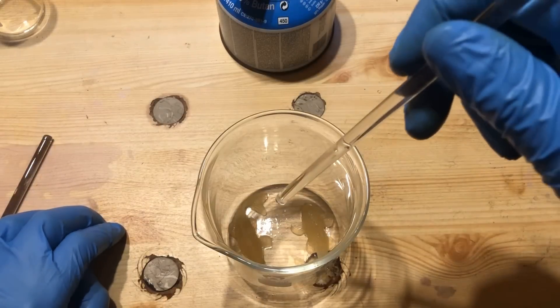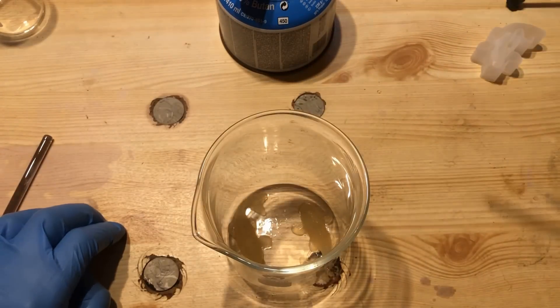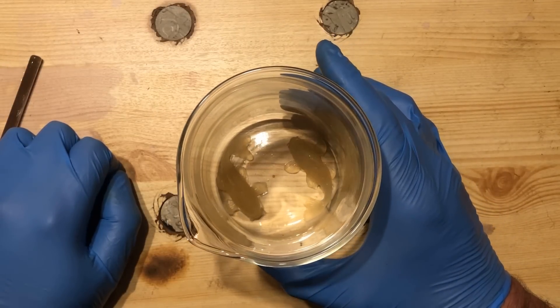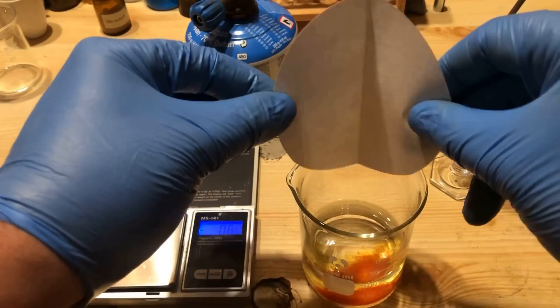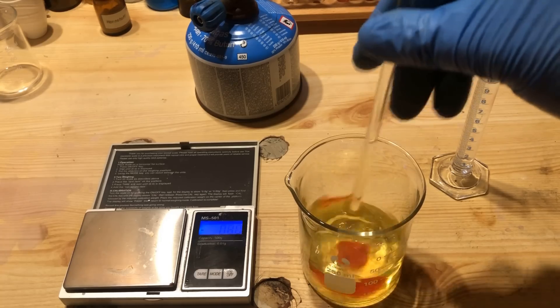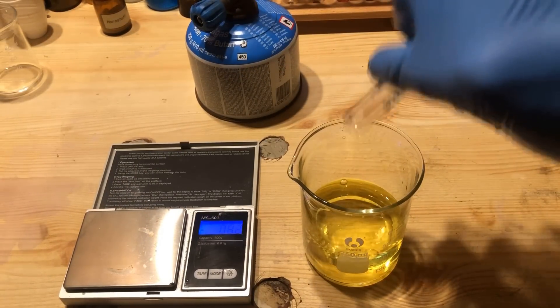The 2 fish are then gently transferred to a beaker. To another beaker containing 90 milliliters of distilled water, we add 1 gram of potassium ferricyanide. After the potassium ferricyanide is dissolved, we add 10 milliliters of 10% hydrogen peroxide solution.